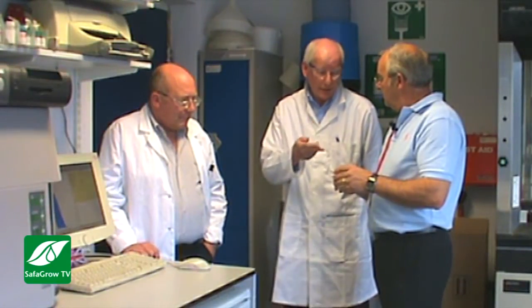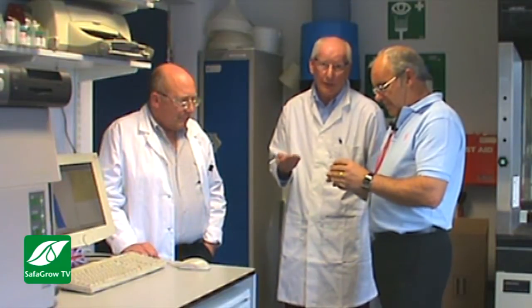Yeah. And what happens is they are turned at a very high speed, tip speed of about 17 metres per second, and you pump the slurry through, and the action of those against each other grinds the particle size of the product from around 35 to 40 micron down to somewhere between 1 and 2.5 micron mean.